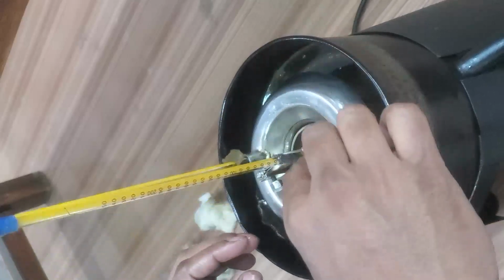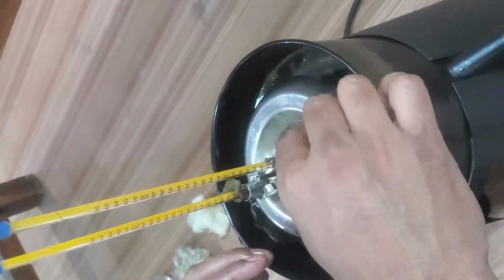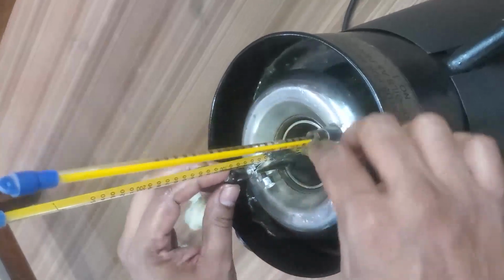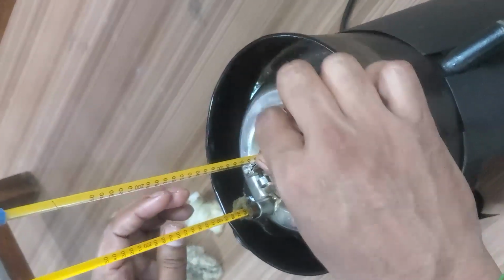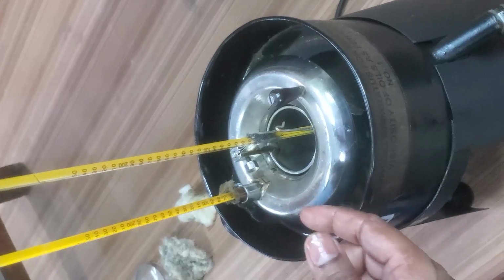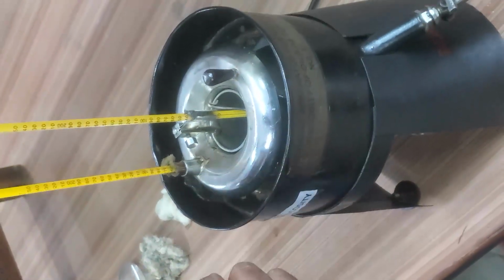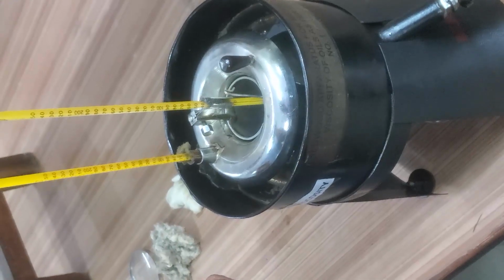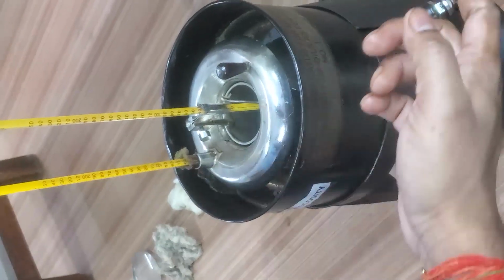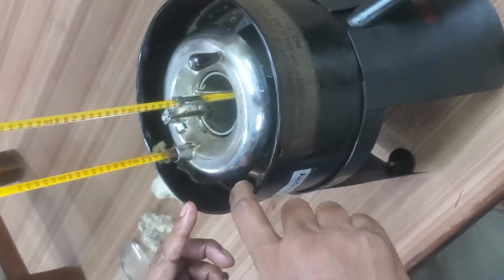While stirring, what will happen? Slowly the temperature will be transferred to the oil. Once we get the required temperature, then we lift the ball and we collect the oil. At room temperature, if we want to determine the viscosity, the heater is not required. When we want to check the viscosity at different temperatures, we start the heater and slowly the temperature of the oil will be heated.